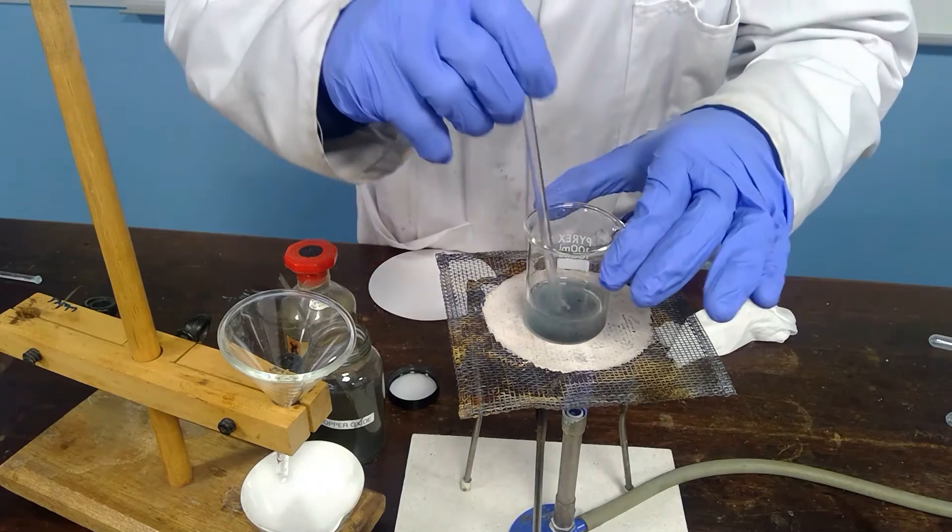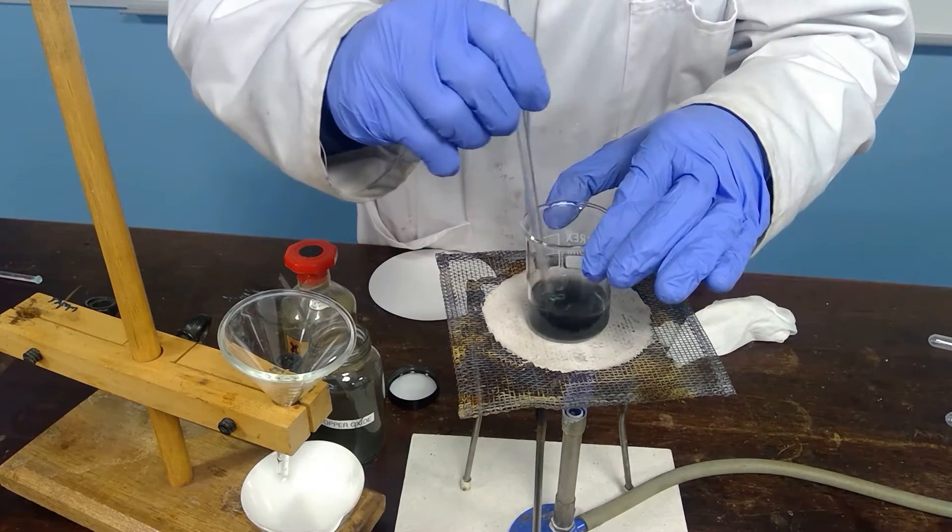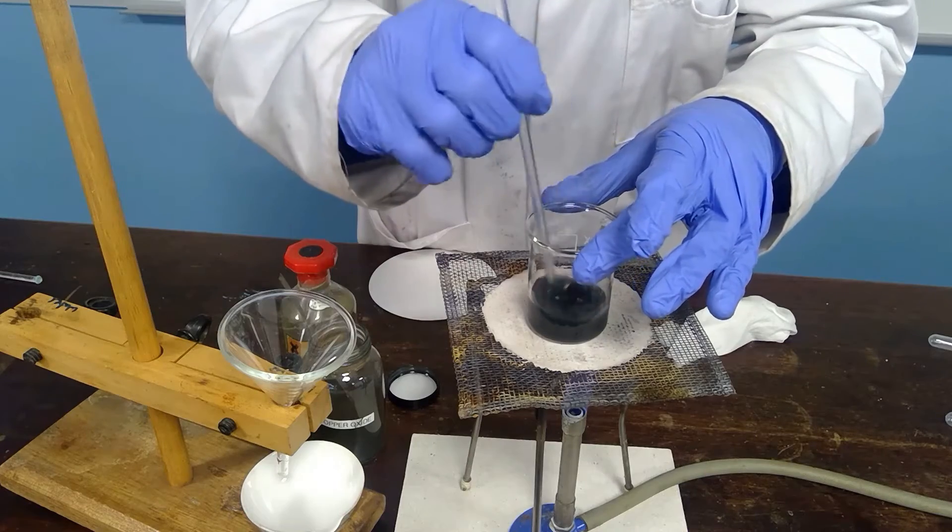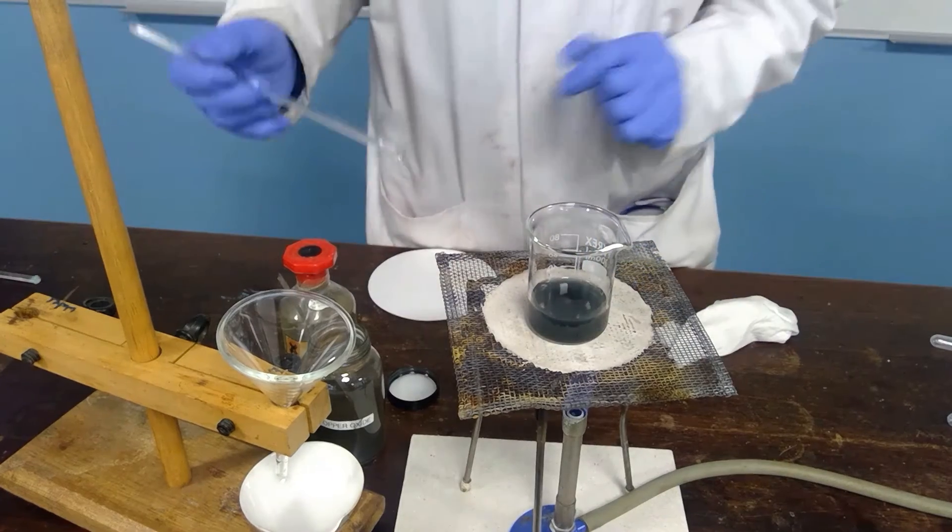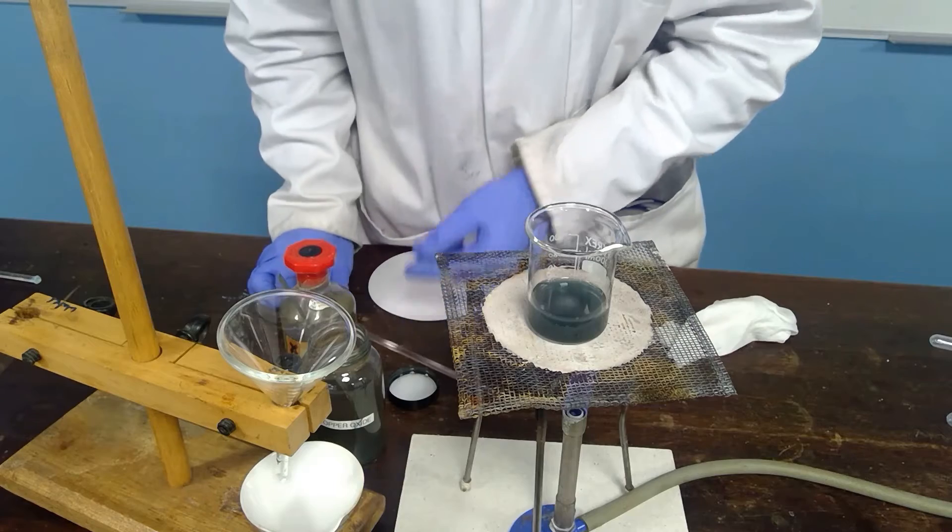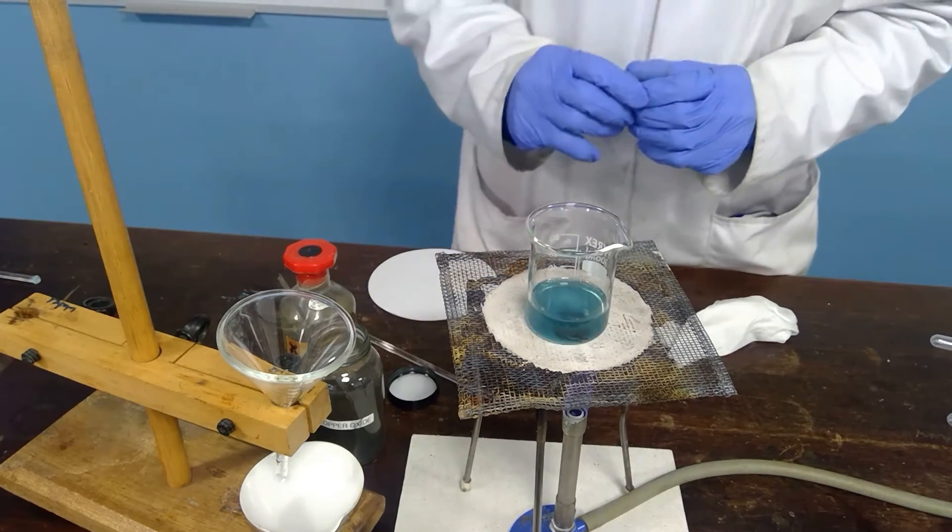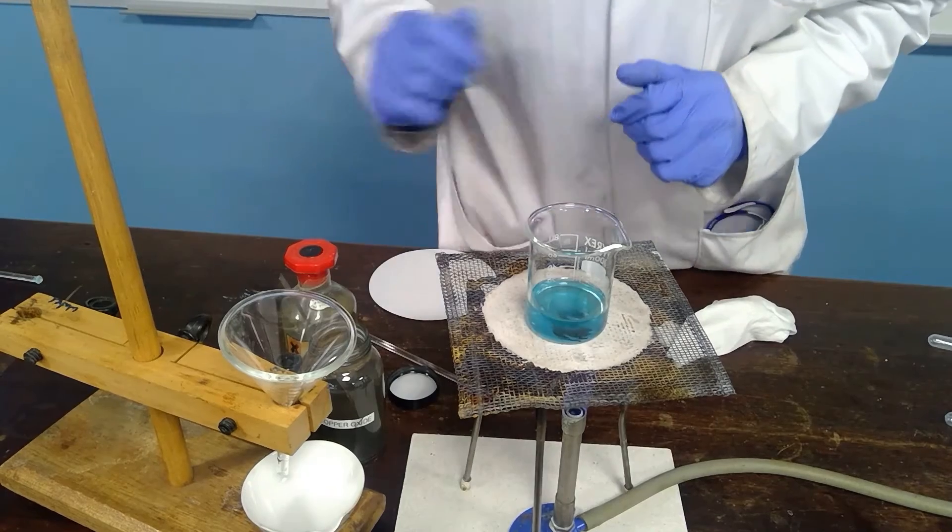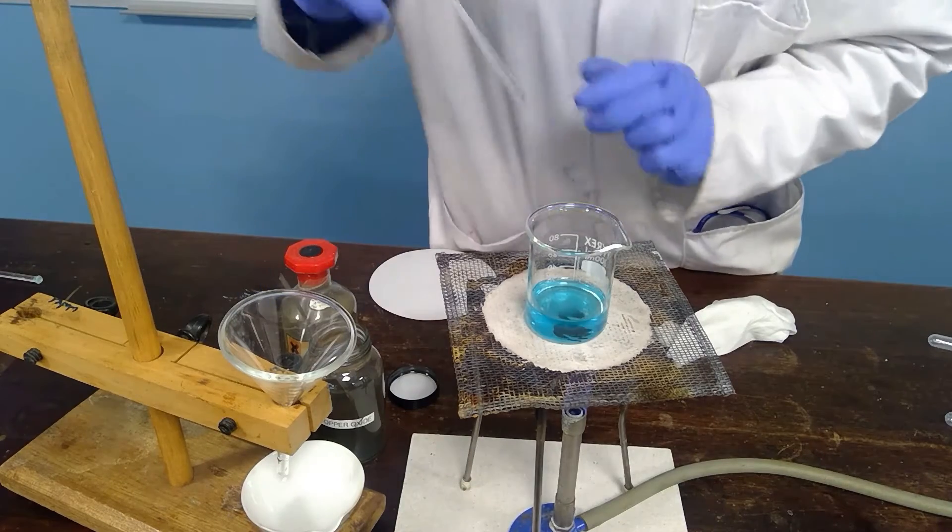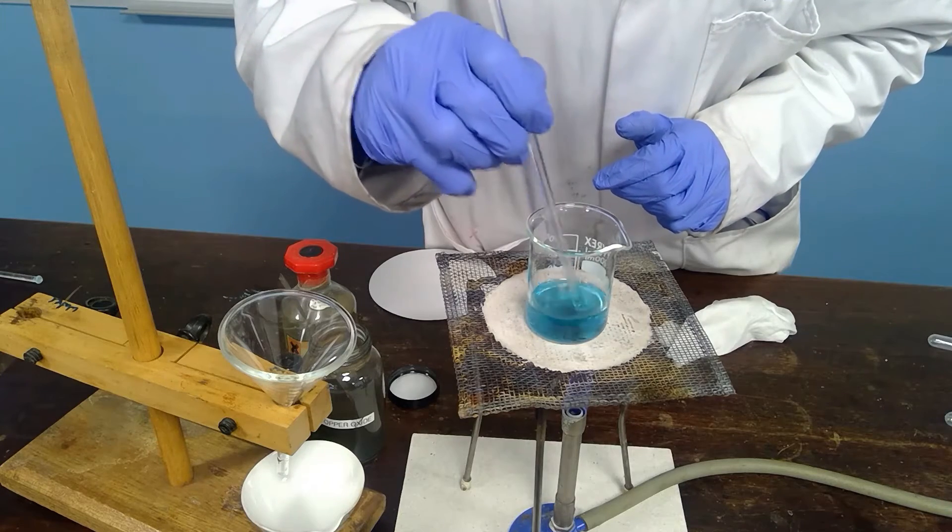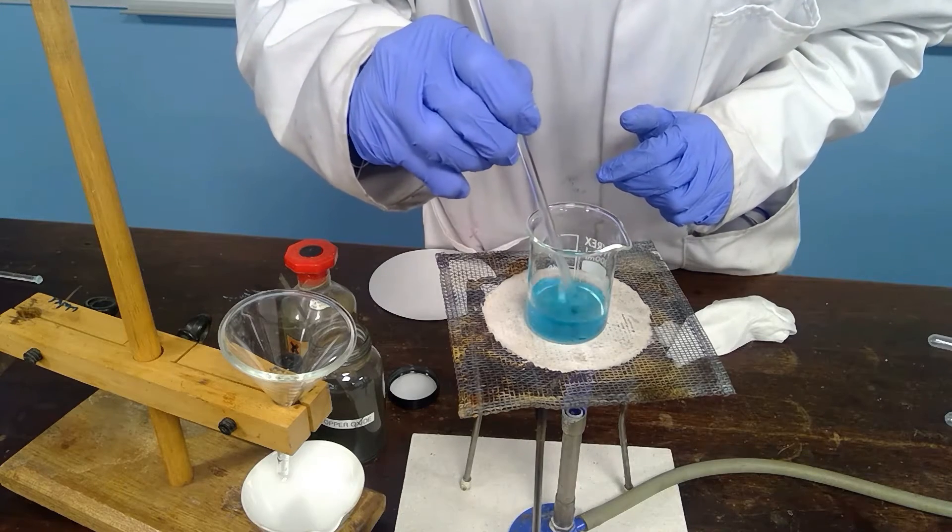And so the black solid appears not to be reacting with the acid or not particularly quickly. But quickly we'll see that it becomes a blue color to the solution and the black solid which is at the bottom with a little bit of stirring quickly disappears.